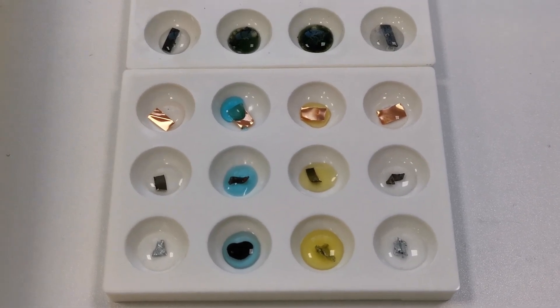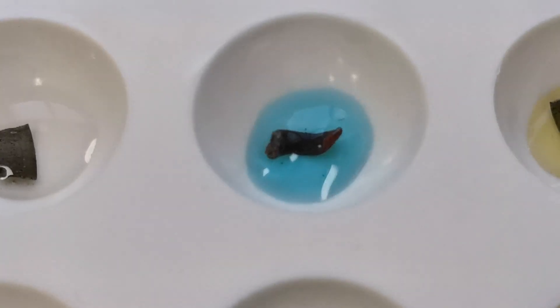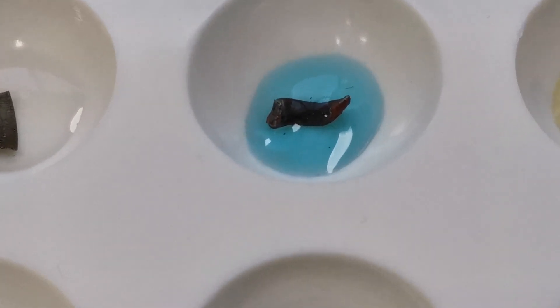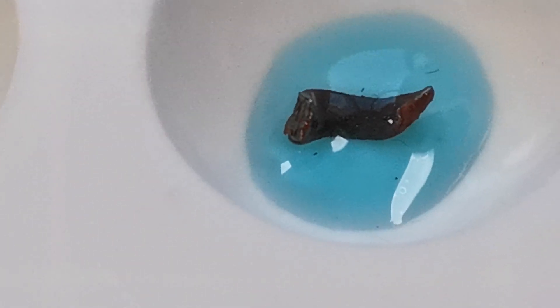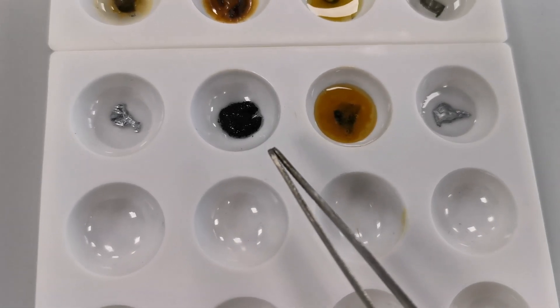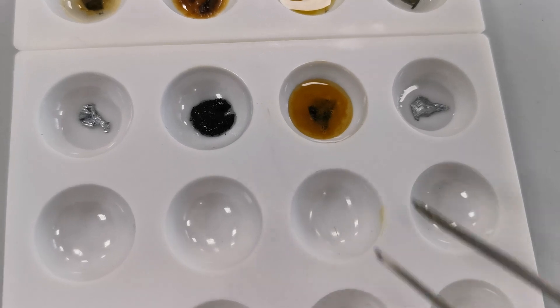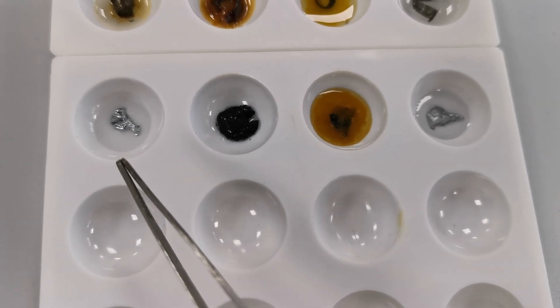After a few minutes, we can see that there is a reaction happening between the copper sulfate and the iron — the iron is starting to turn an orange-brown color, and there are deposits of copper forming. It's just a very slow reaction. Given the zinc more time, there is now a definite reaction with the copper sulfate and zinc, and with the iron sulfate and zinc. But there doesn't seem to be any reaction between zinc and zinc sulfate, or zinc and magnesium sulfate.